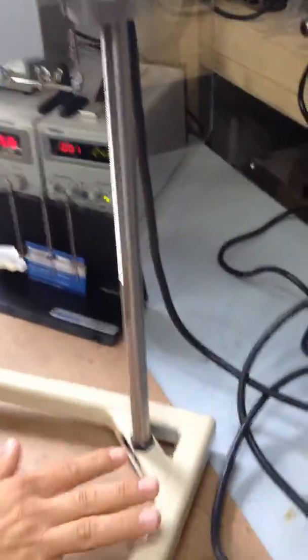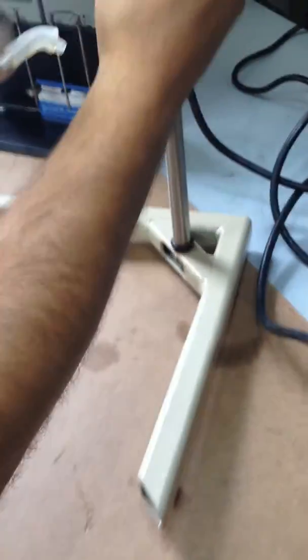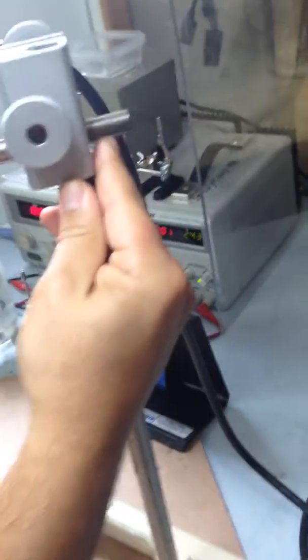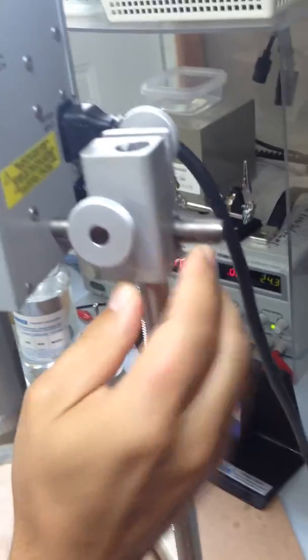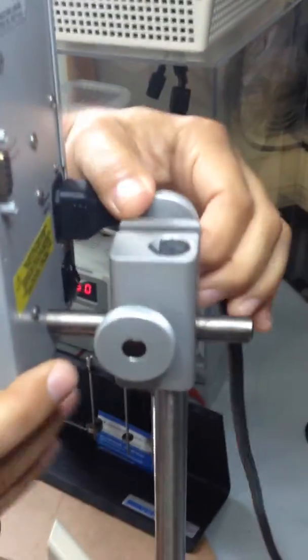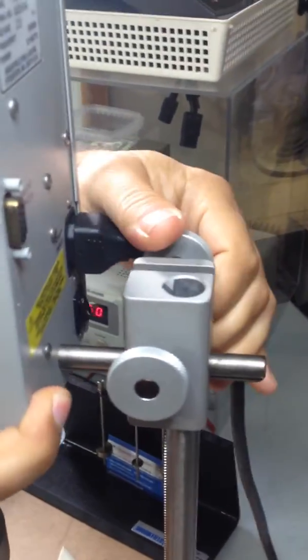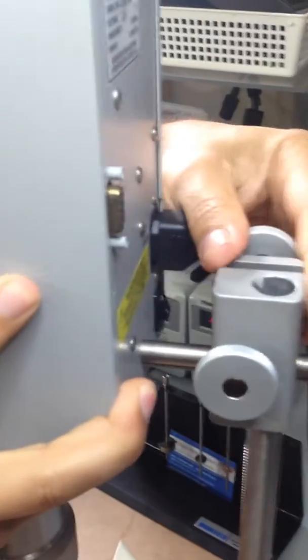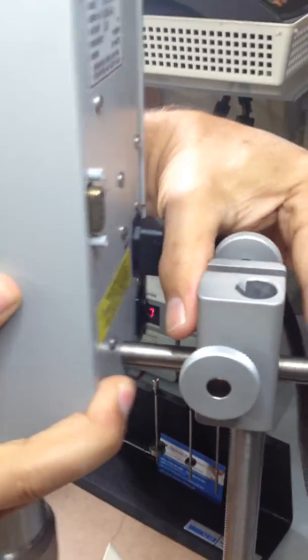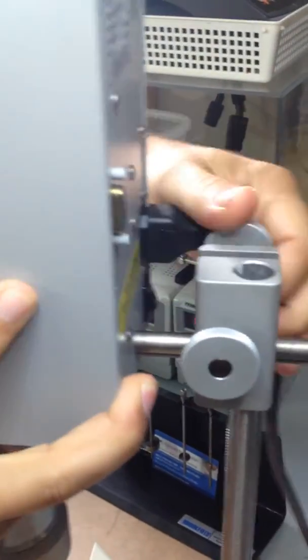One thing you did talk about, the stand. We made this homemade here. The only thing you have to do is, it's actually held by these things. If you turn this one you'll be able to move your viscometer or remove it from its stand.